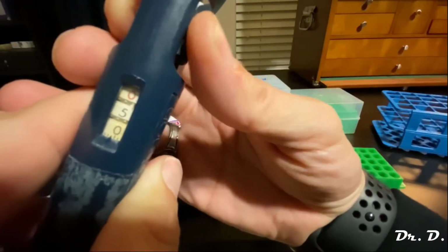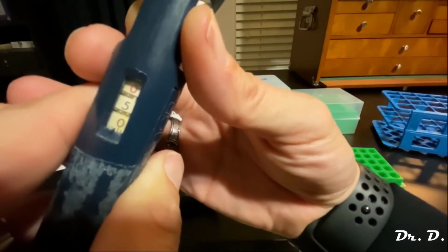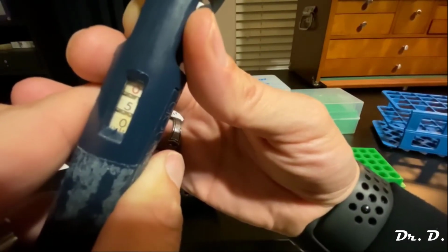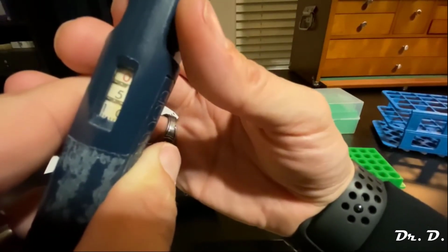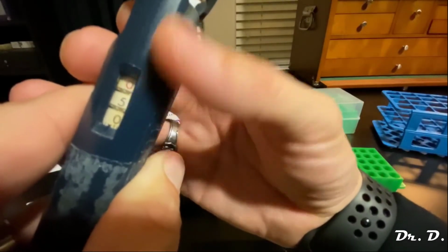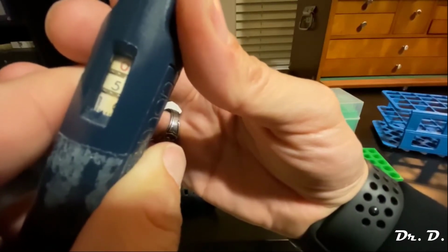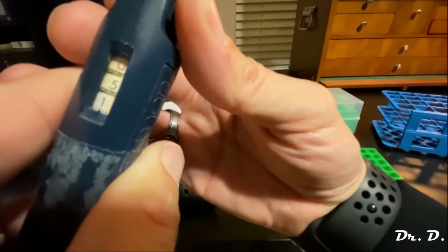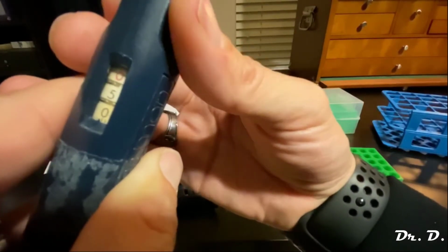So what would this be? Let's see. That would be 502. That would be 504, 506, 508, 510. Does that make sense? So 500. That's 500.